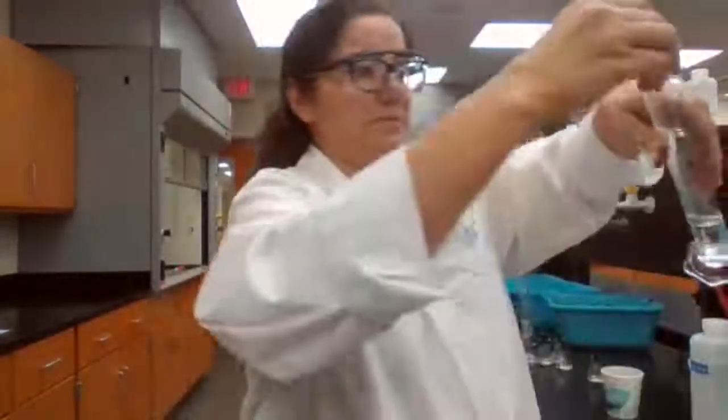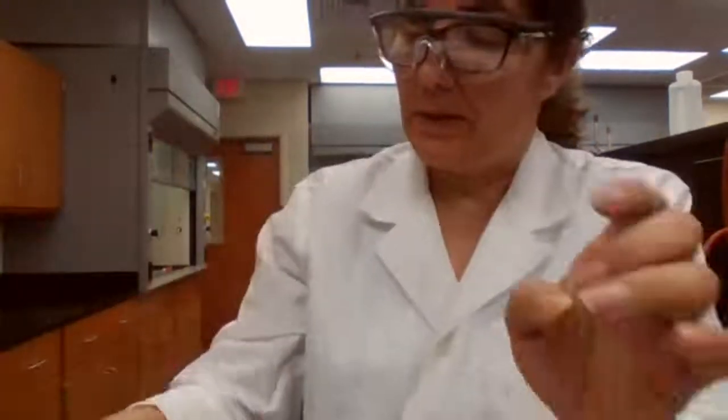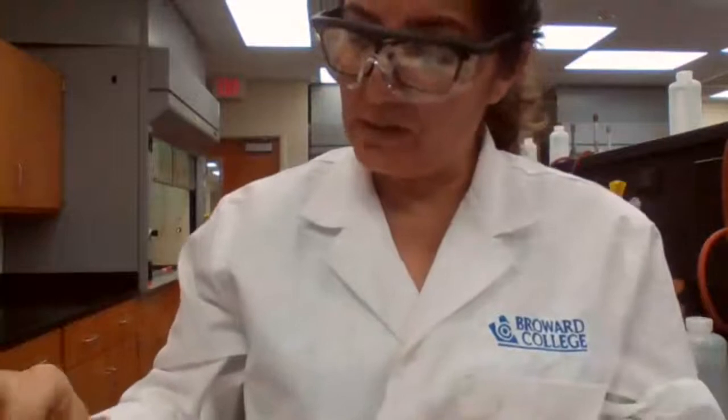We're going to drop the sample in, slide it in, and the number is 35.0. Okay, so you find the volume, you have the mass, you divide mass by volume in order to calculate the density for the two unknown solids that you have.